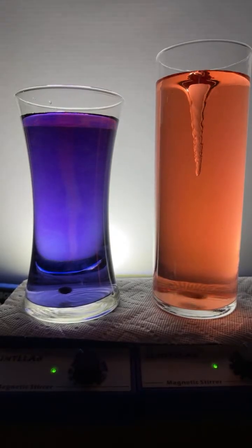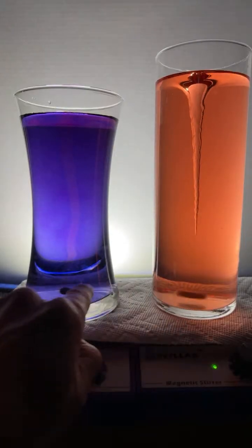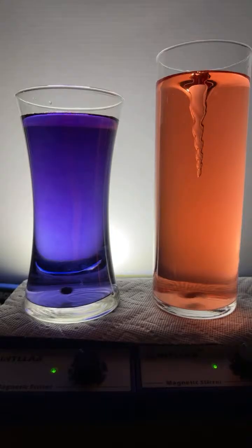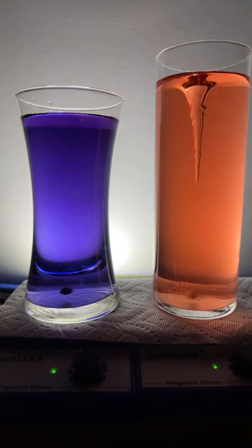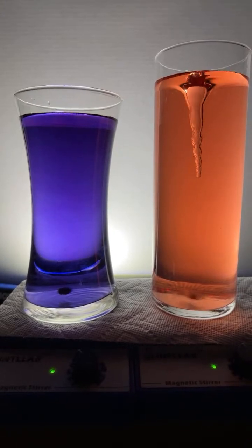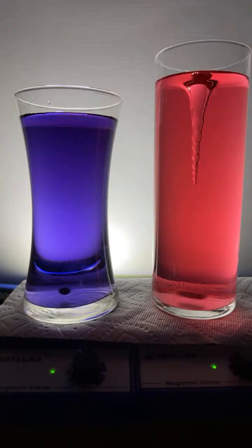There are a couple of differences between the glasses: the stir speed, and you'll also notice that this has a larger stir bar, and this one's much smaller. Can I make it go from green to purple? Let's try it. They want dark red, too. I'm getting a little behind on the comments, so we're going to go really dark red here. That's correct, it's universal indicator, Chris.